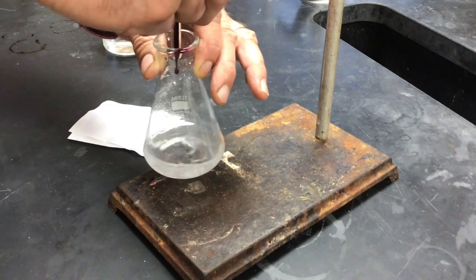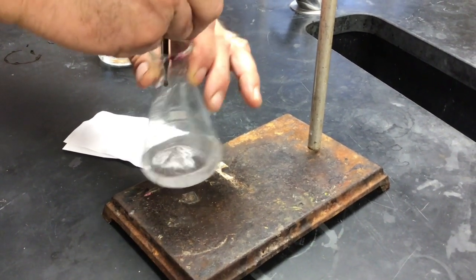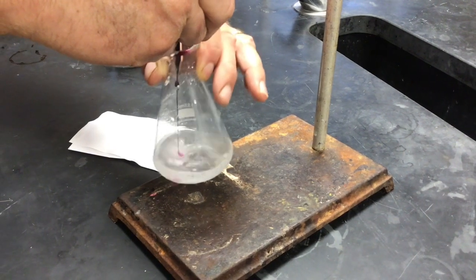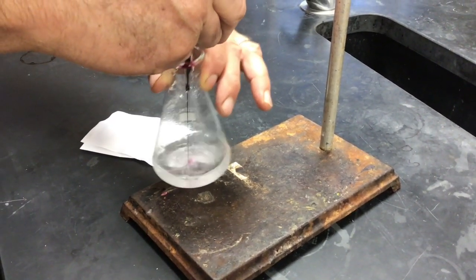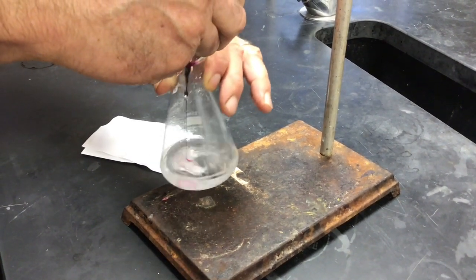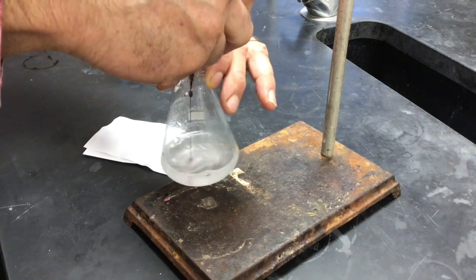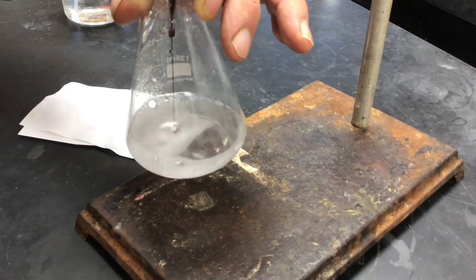As we're titrating here, the peroxide is in excess, and so the permanganate is used up very quickly. But what we're looking for is that drop that turns this pink and keeps it pink. And also, Mr. Moore, it looks like there's more than just a color change going on. It does. What else can we see?